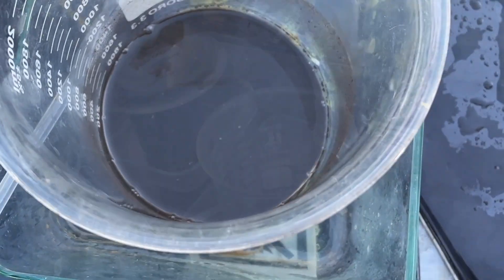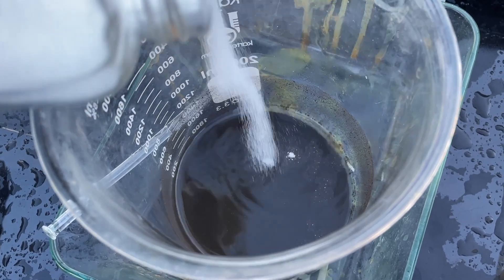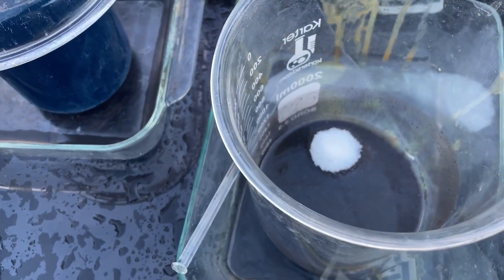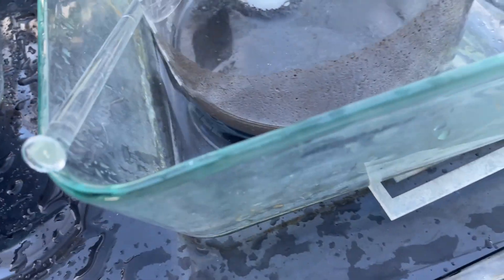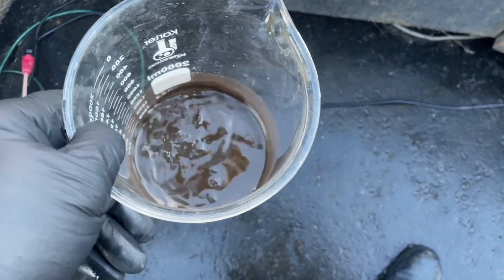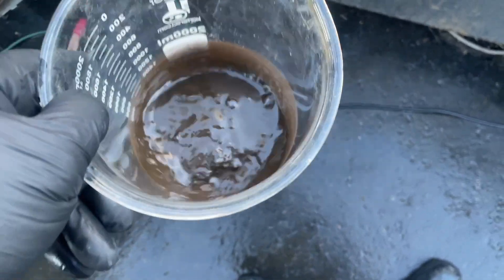Let's try some sugar. I know you're supposed to stir it while you're doing it, but I'd rather do a little experimentation. I'm gonna put a little pile right there — I think that's plenty to do the whole conversion. Watch the thing switch to silver metal. Oh look at that, there's a big clump in the middle. See it change already? It's looking silvery — it's looking right.